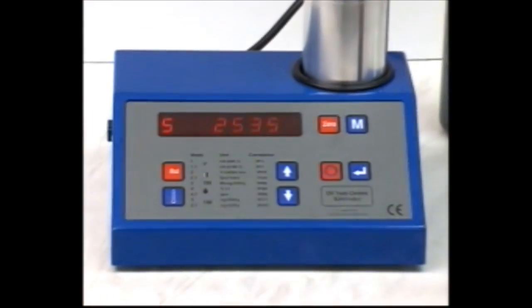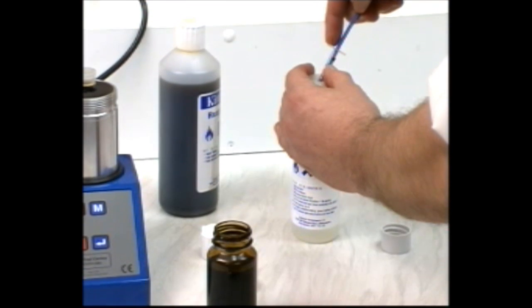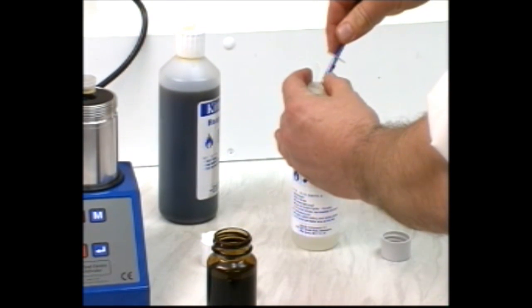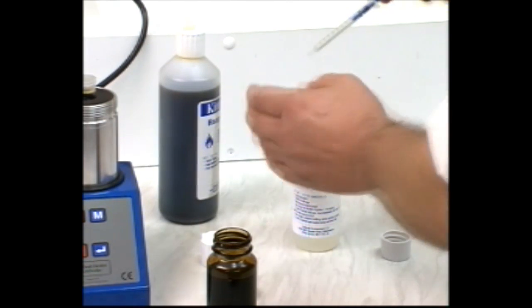TAN is indicated by a reading higher than zero. Take one milliliter of reagent E using a syringe and add one drop to the TAN tube.